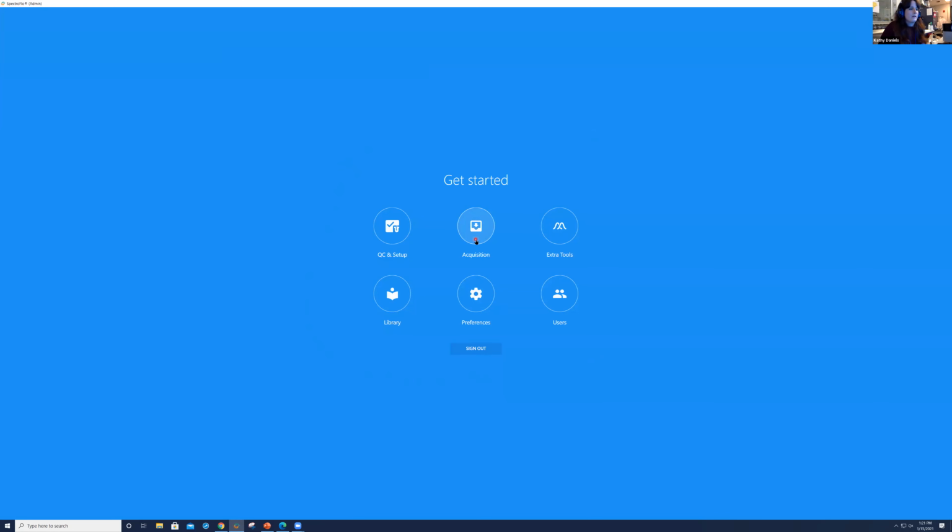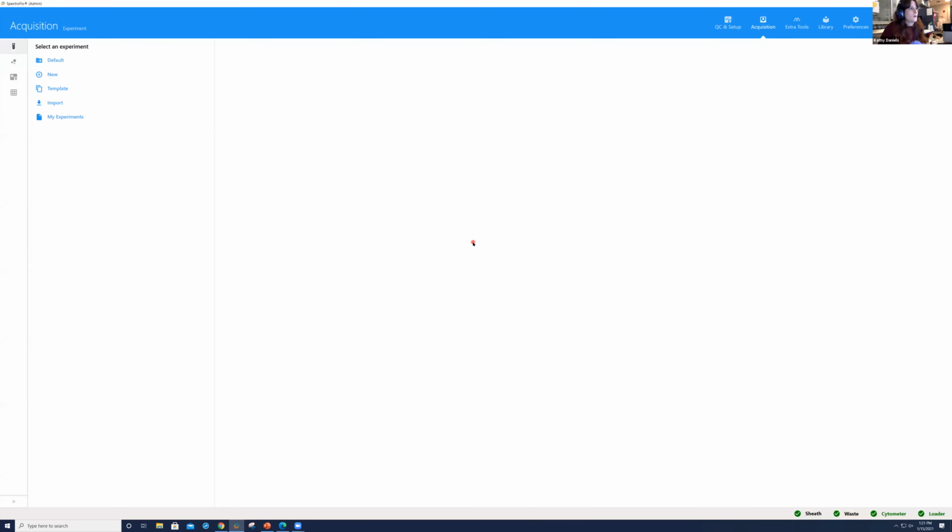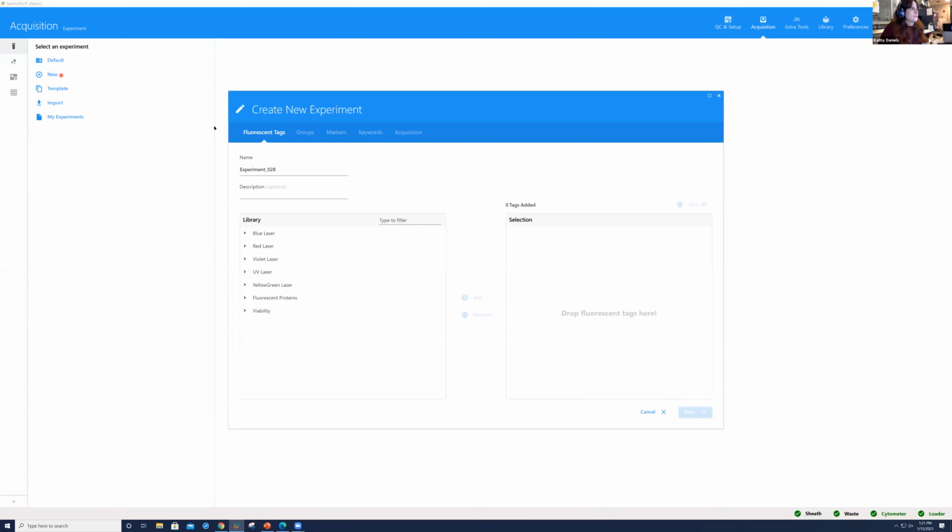So we're going to go ahead and get started. Once I click on acquisition, I'm going to get started with a new experiment, okay? Once I select a new experiment, it's going to let me put in all of my experimental details. So I'm simply going to name this CD4, CD8 test, OpenFlow. Okay. Now here in the library, we can choose which fluorochromes we're using for our experiment.